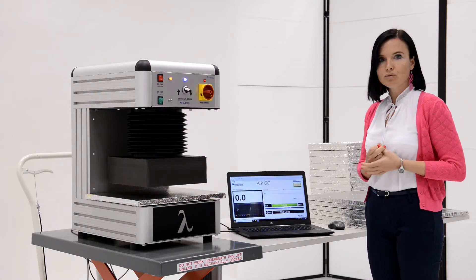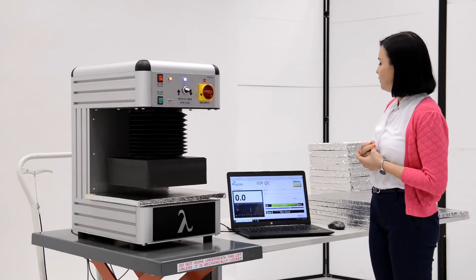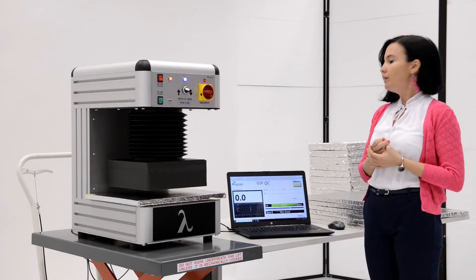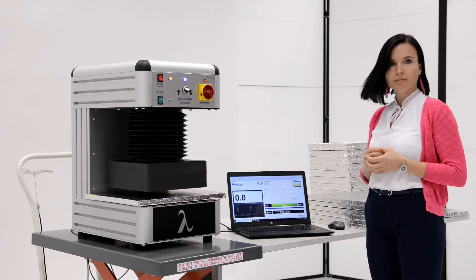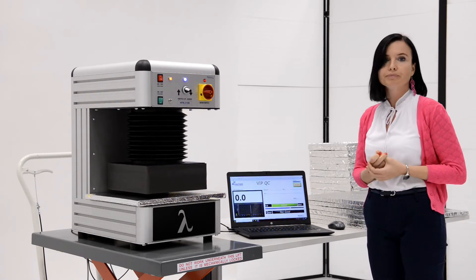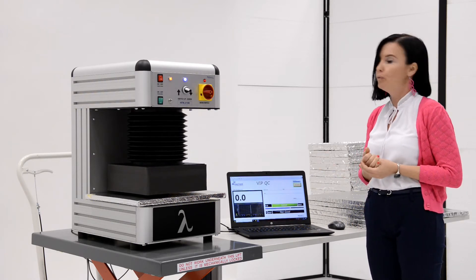The measured value should be compared to 26. If the result is bigger than 26, the panel will be marked as not good. If it is lower, it will be marked as good, which will be visible in the program window.